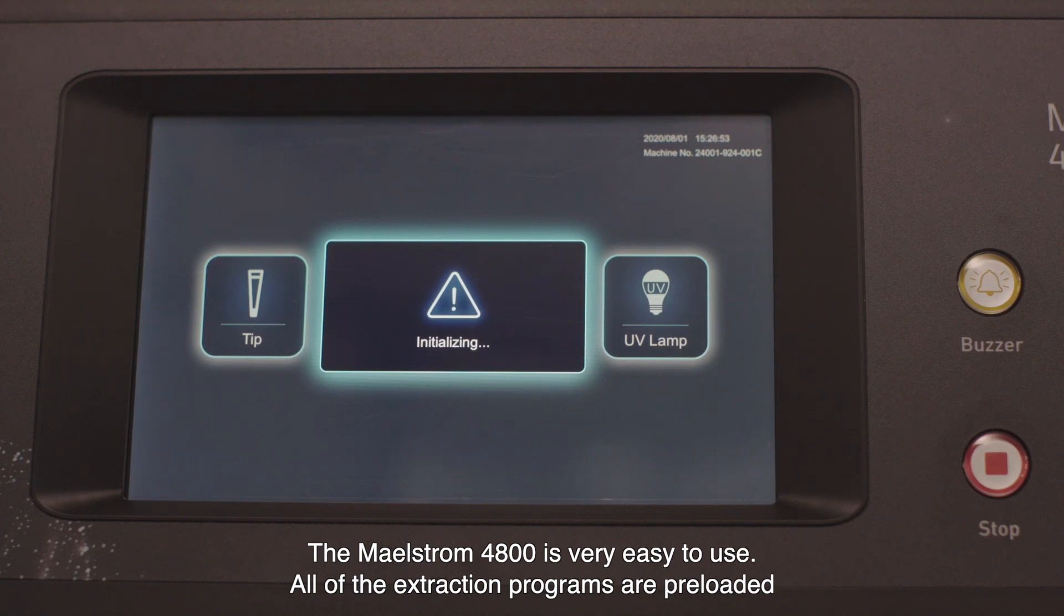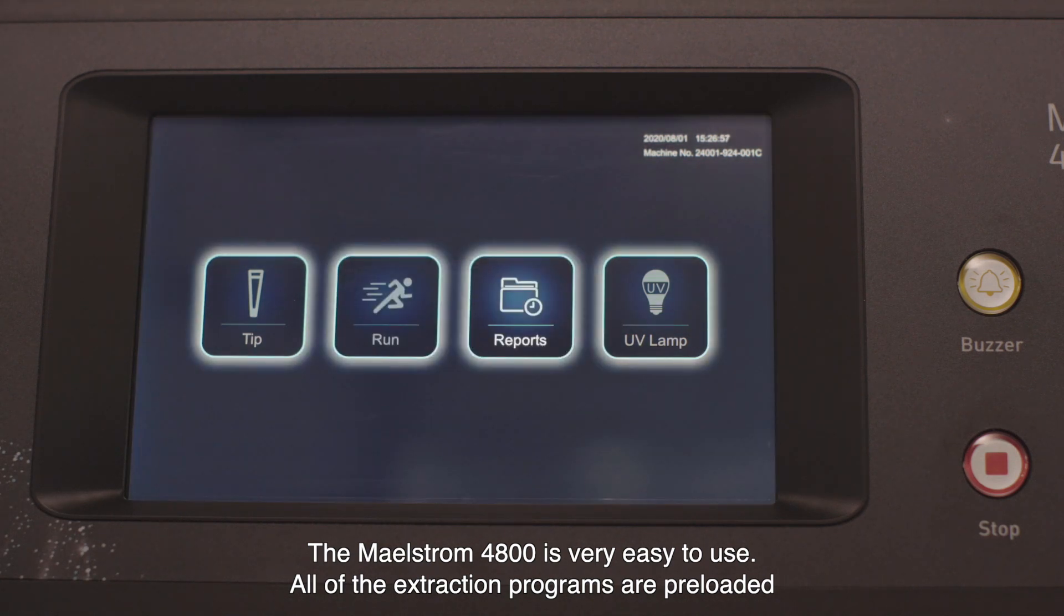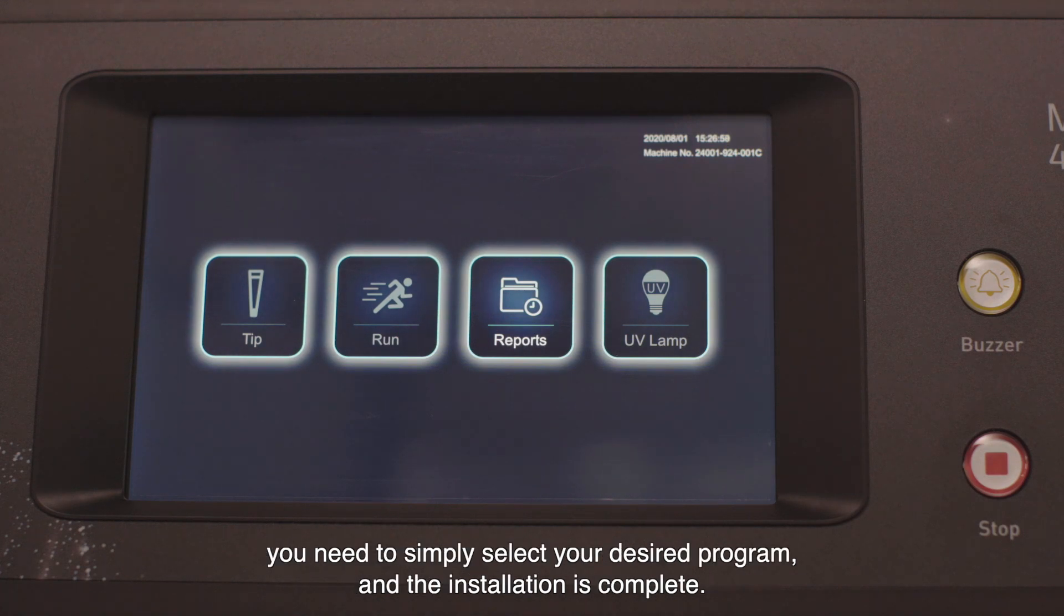The Maelstrom 4800 is very easy to use. All of the extraction programs are pre-loaded. You need to simply select your desired program and the installation is complete.